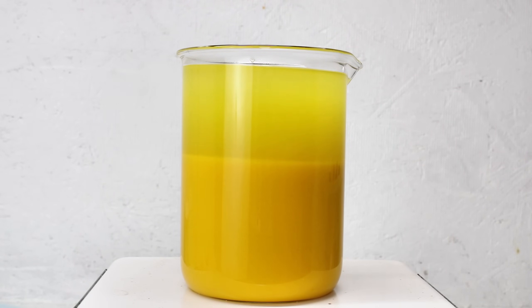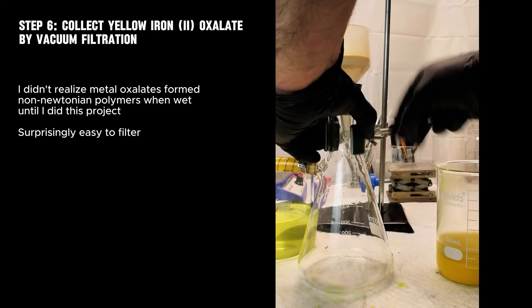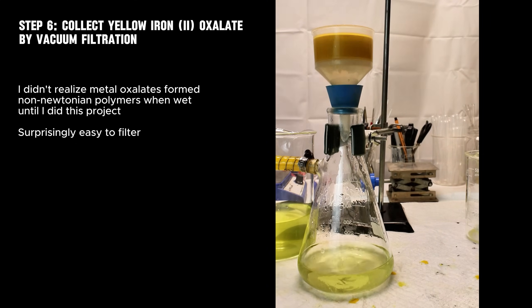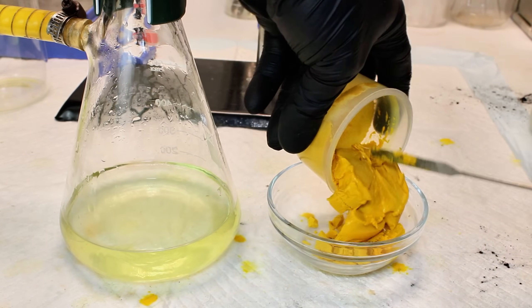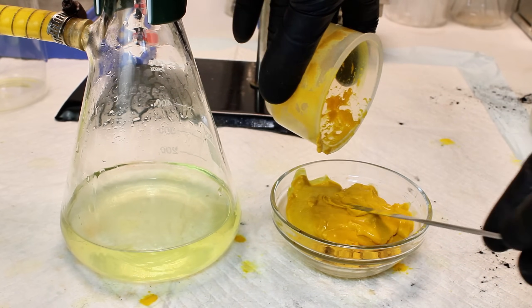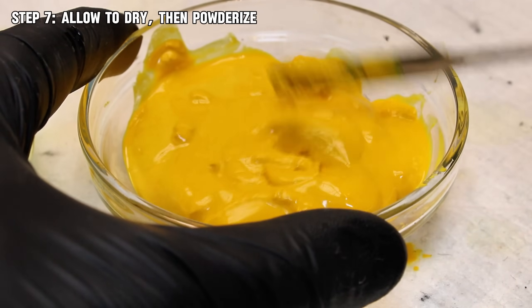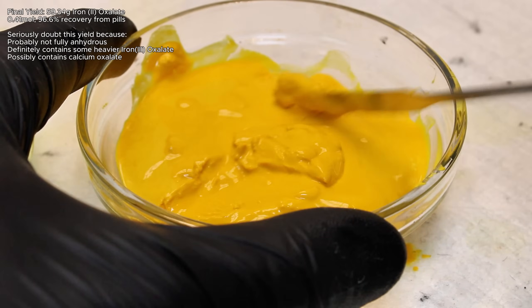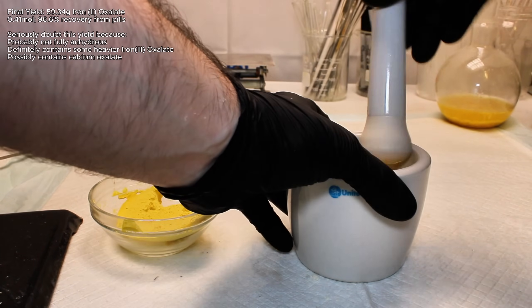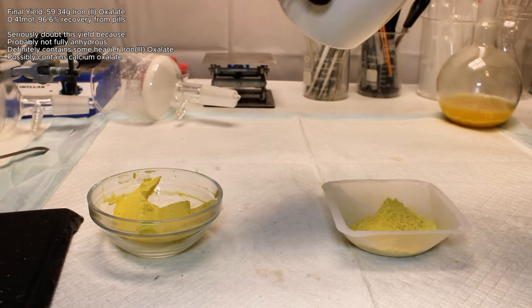This quickly began to settle out of solution, and to collect it, I simply passed my solution through vacuum filtration. The resulting iron oxalate had a non-Newtonian consistency nearly identical to corn starch mixed with water, which was interesting considering I didn't expect the wet iron oxalate to behave this way. This was allowed to dry completely over the course of several days before I began the miserable task of powdering the rock solid chunk that had formed. This took a while, but in the end I was left with 59.34 grams of ferrous oxalate, which represents 0.41 moles and a 96.6% recovery from my supplement pills. Even though this was heated under vacuum for several hours, I am skeptical of this yield, so assume there's a bit of hydrated ferrous oxalate remaining.